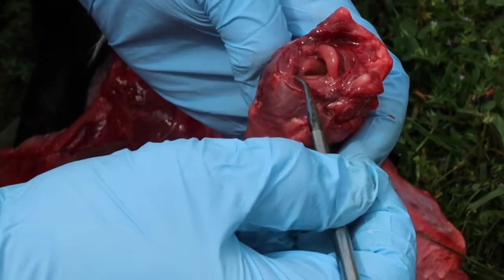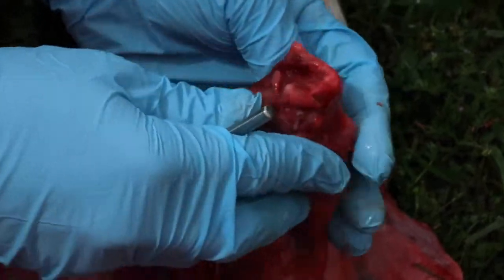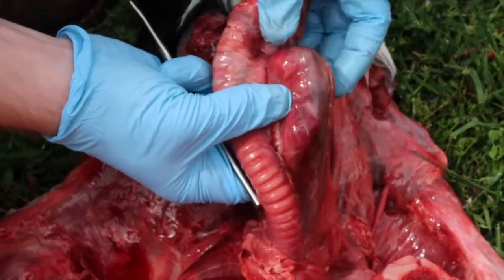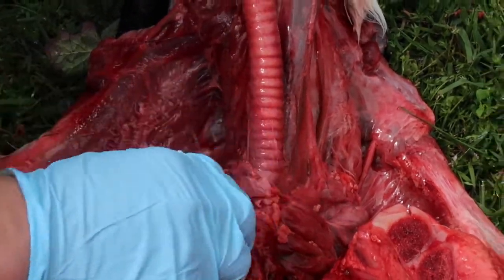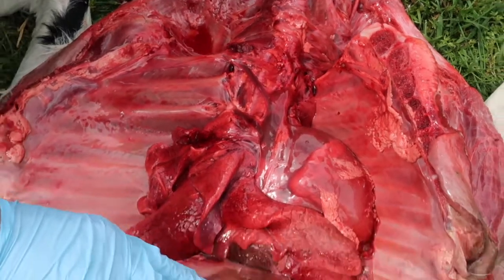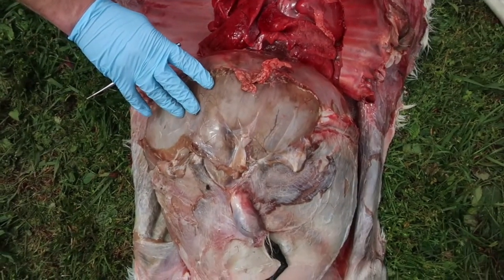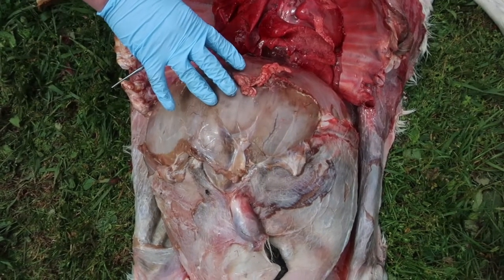And that food will then go down into the esophagus, which is just right down through here. So we have the trachea here, and then the esophagus underneath, right here. And then food will pass through the esophagus all the way down into the first part of the forestomach of the ruminant, called the rumen, and also the reticulum.